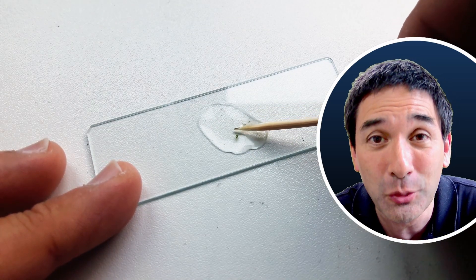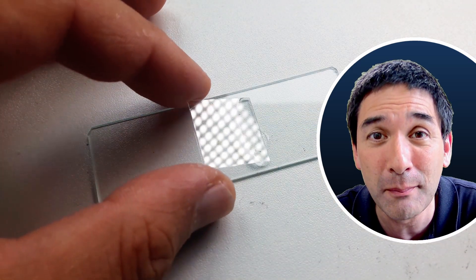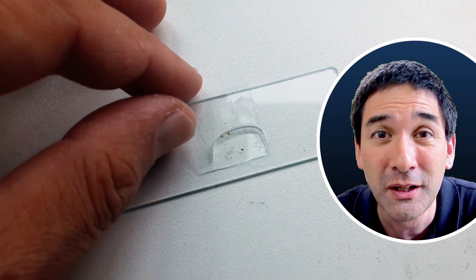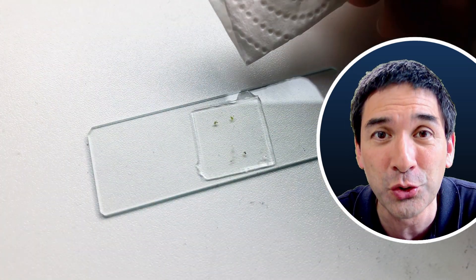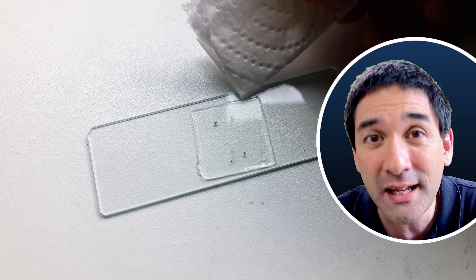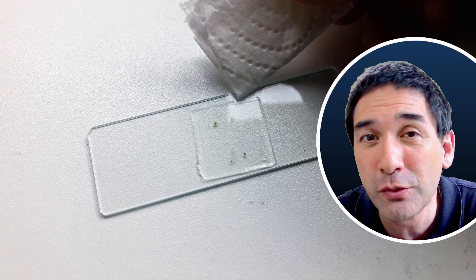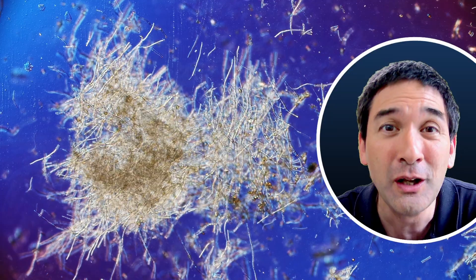Preparing the sample is quite easy as always. You take a small sample and you put it into a drop of water. A cover glass goes on top and any excess water should be removed with a tissue paper, and this is what I saw.